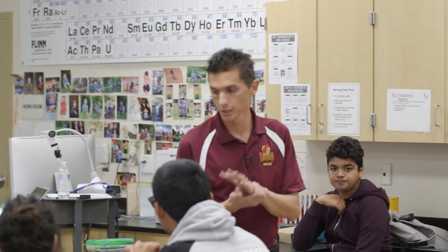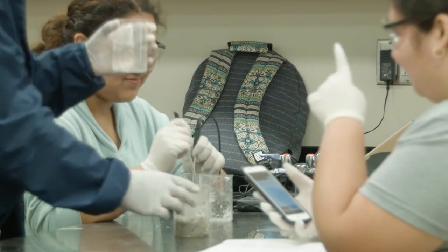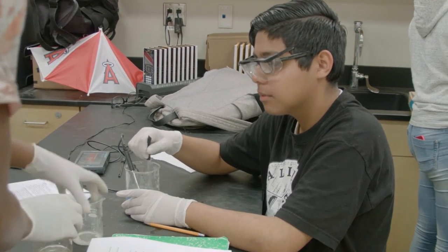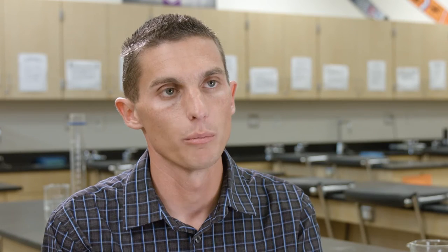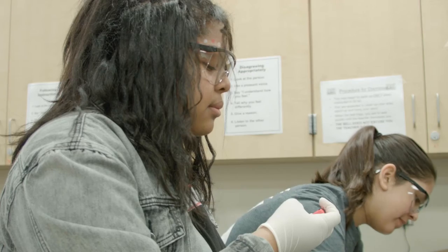You will be in a group of four. This group of four will be executing four different experiments. Everyone has a role, and if you don't do your role, your group won't finish in time — you're going to have about 40 minutes to complete four experiments. Each group was charged with performing four experiments: concrete mixed with water, rock salt mixed with ice, the ingredients of cold packs, and the chemicals for hand warmers. They mixed them, put a temperature probe inside the beakers, and monitored the temperature change over time.